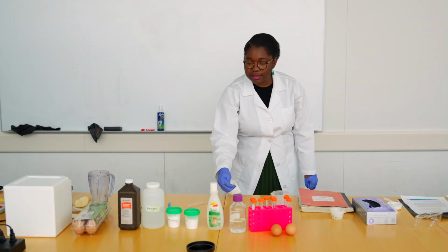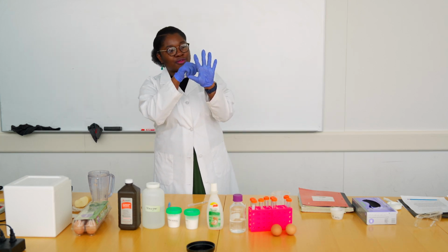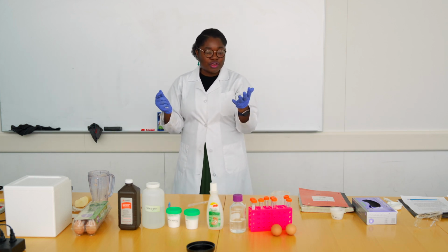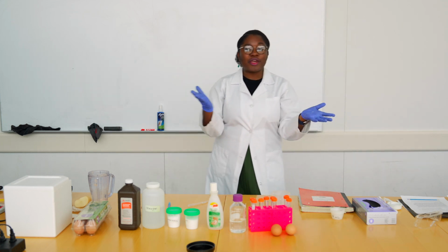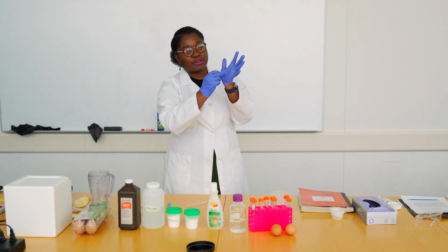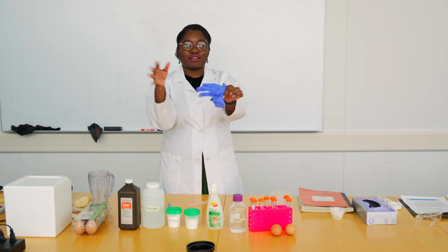And let's say in the process of working here, your hands become dirty. As you can see, my gloves already have some potato starch on them, so I can change the gloves. If you're working with chemicals, you don't want your skin to touch anything, so there is a way to remove your gloves without touching them. This is my hand that has the potato starch on it. Use my hand that is in a glove, pull it inside out, and here you're just going from your cuff that didn't touch anything. There you go.